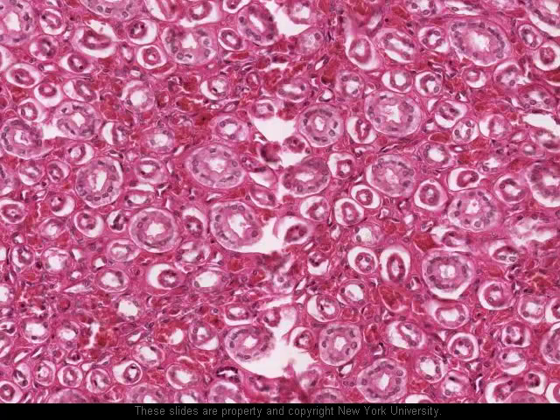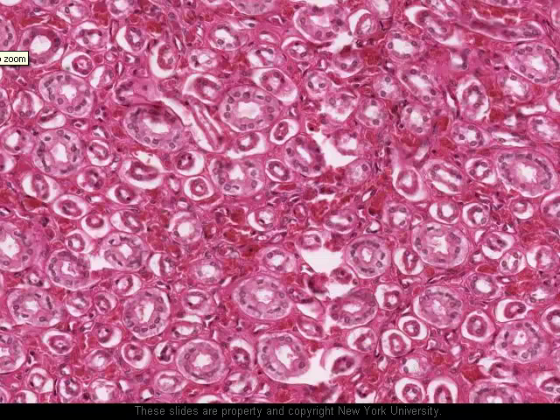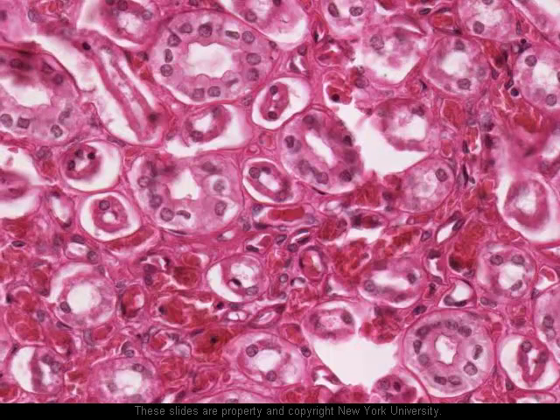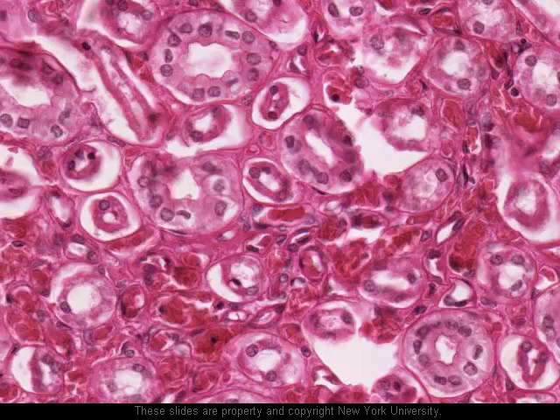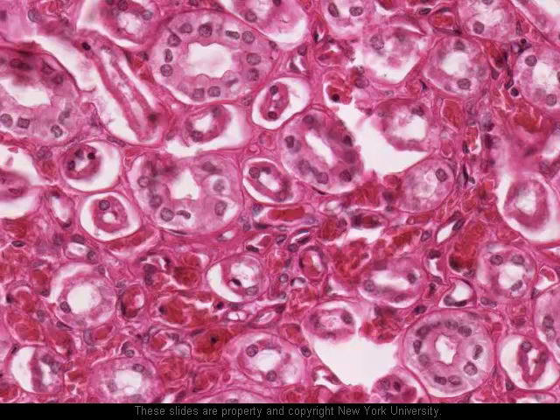Interspersed among the collecting ducts are these structures here, which are lined by a simple squamous epithelium. These have actually shrunken during the course of tissue preparation, so they've pulled back from the little bit of basement membrane which would have surrounded them. Here's one here, here's one here, here's one here — and these are the thin limbs of the loops of Henle. As you know from your notes, the function of the loops of Henle is to create and maintain the interstitial sodium gradient which is exploited by the collecting ducts to retain or lose water as is necessary depending on the presence or absence of antidiuretic hormone.